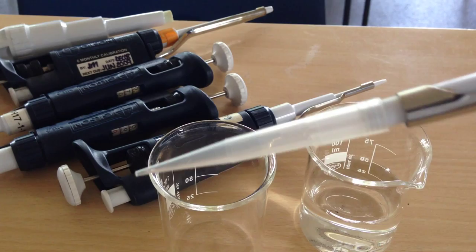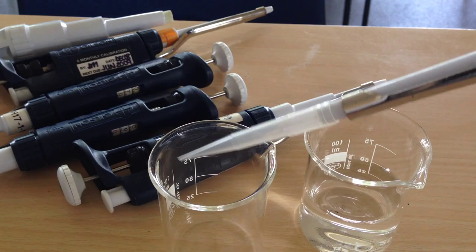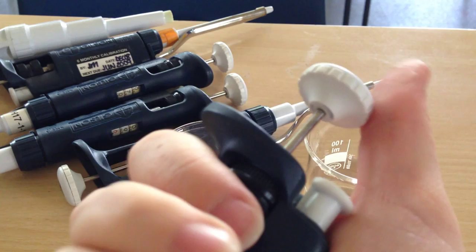And then you depress the tip. And on some of them, you'll notice it retains a bit of water in there. And that's what the second stop is for, for getting that bit of water out.